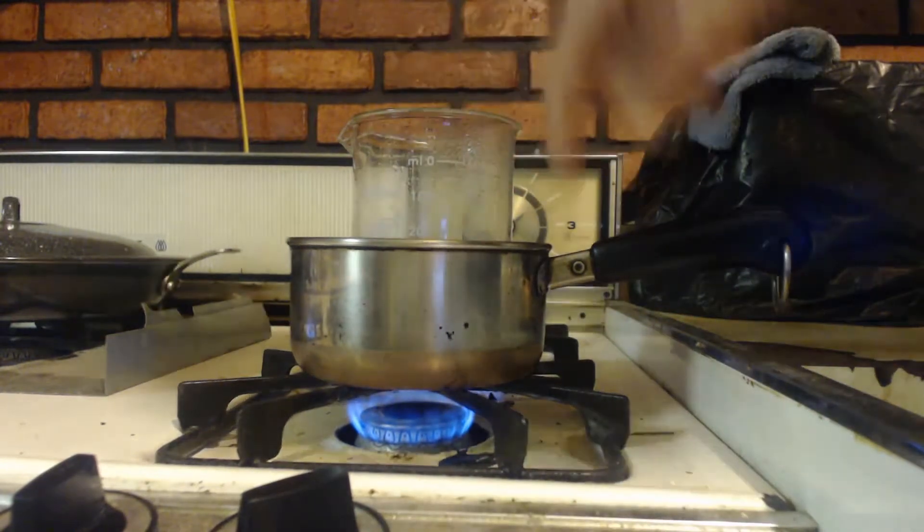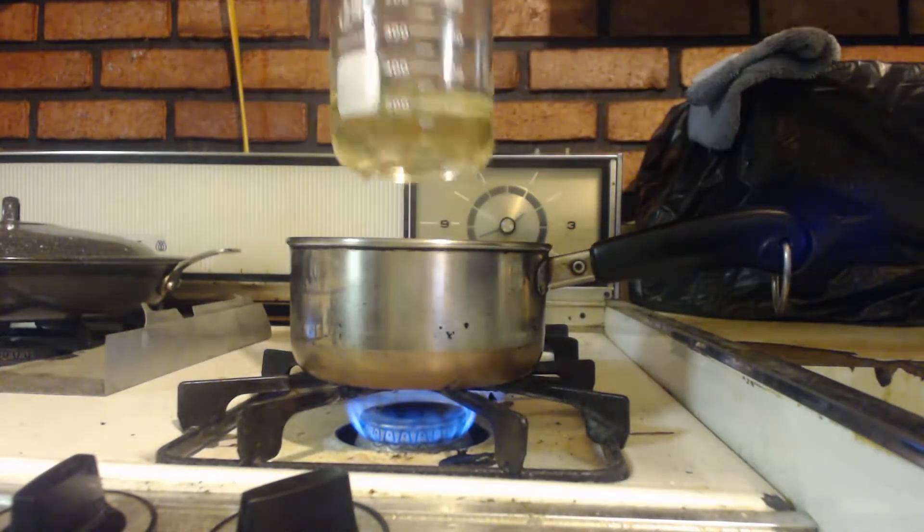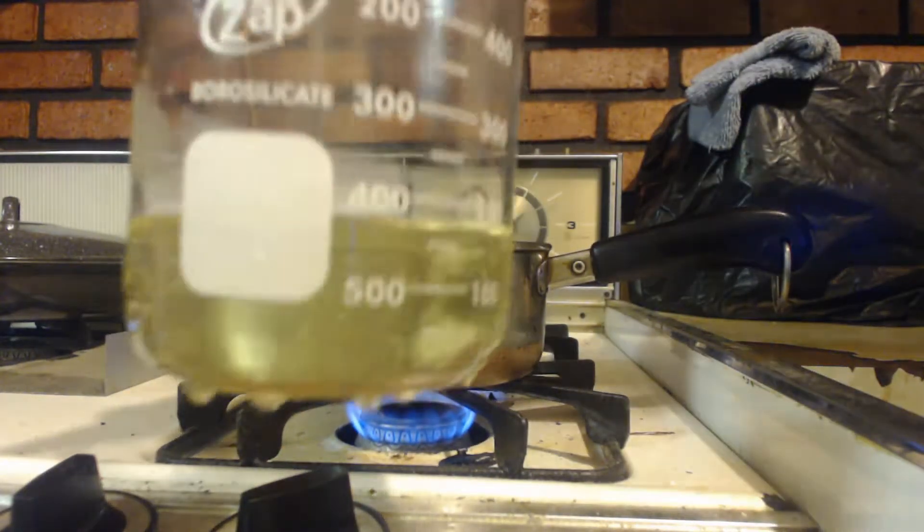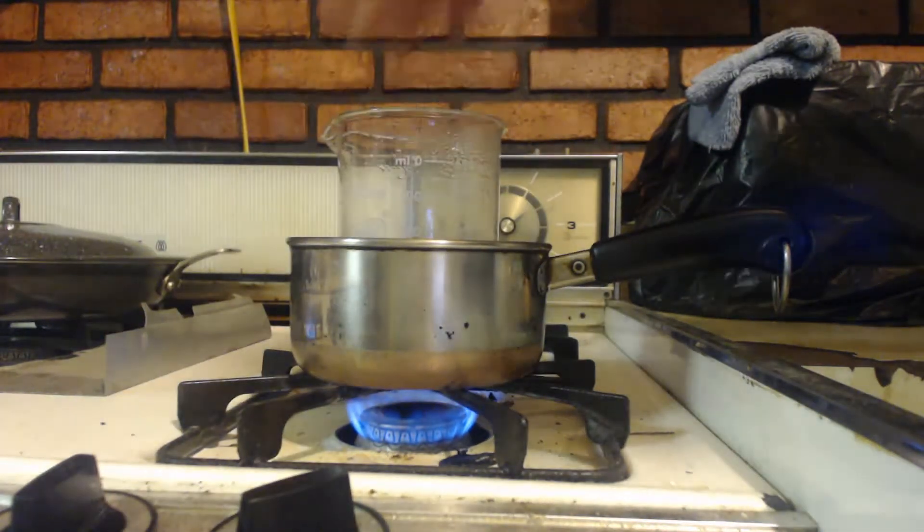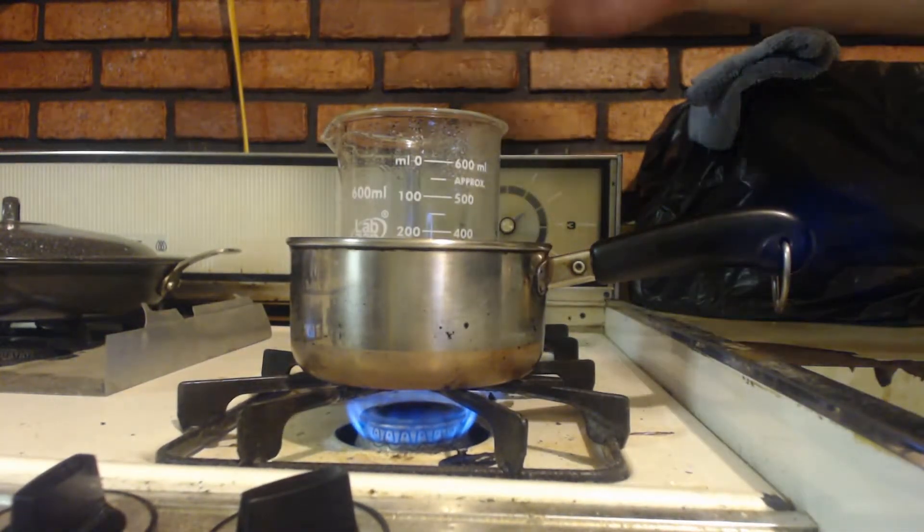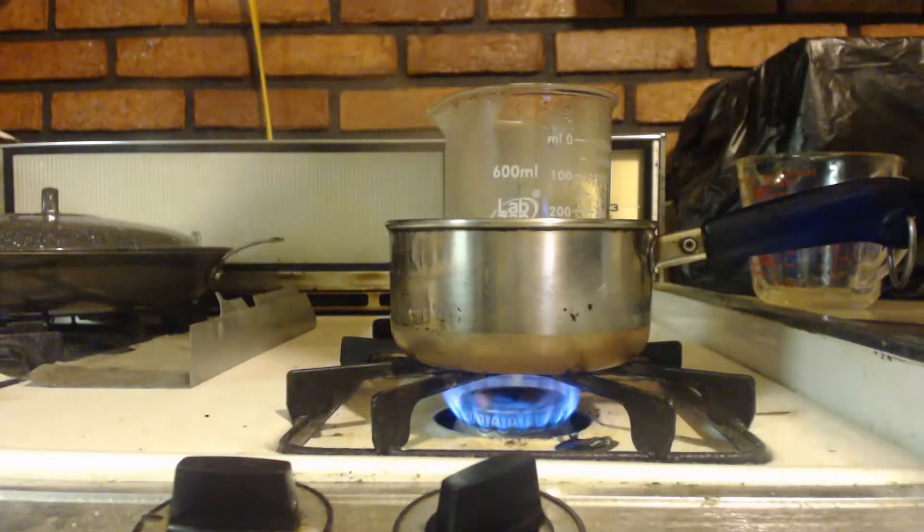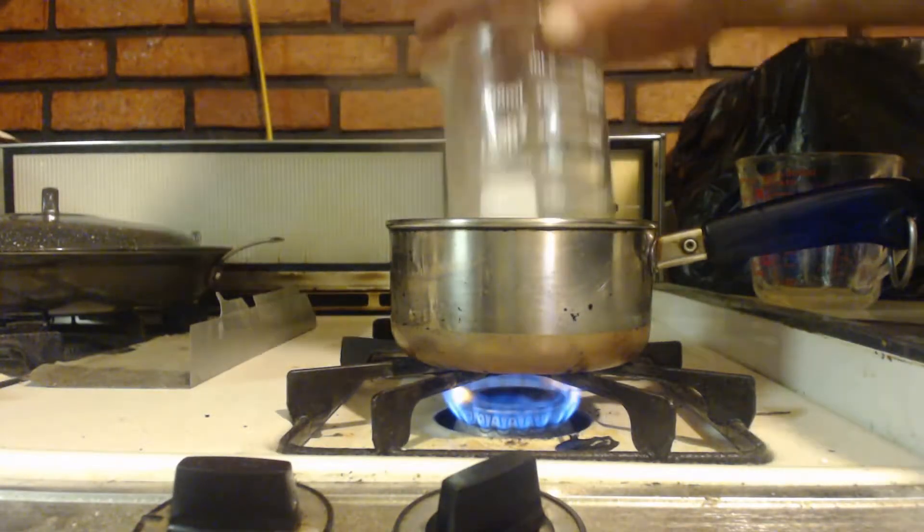I got it on the heat here. There's water inside here heating it up. You can see it's yellow. I'm gonna try to get this to boil, basically just trying to evaporate the water away. I got it boiling here and it's starting to recrystallize. There are little crystals coming out now.